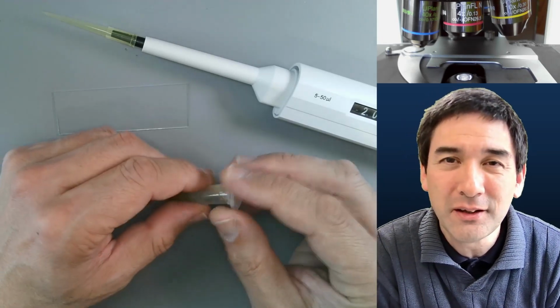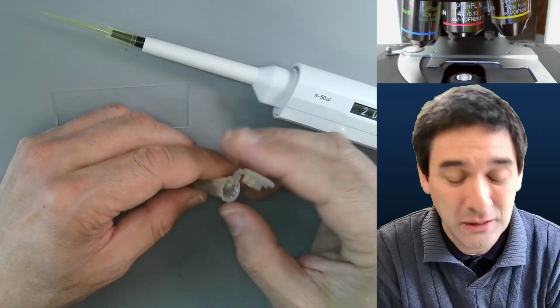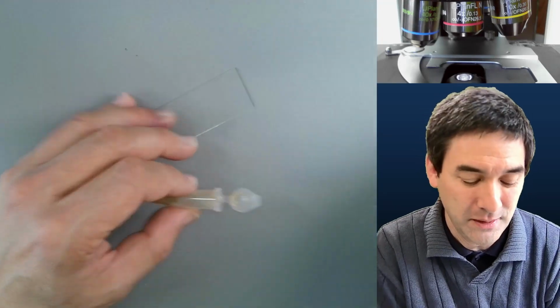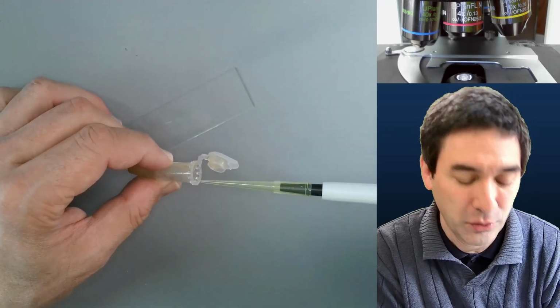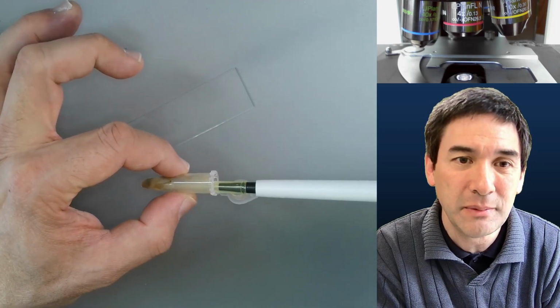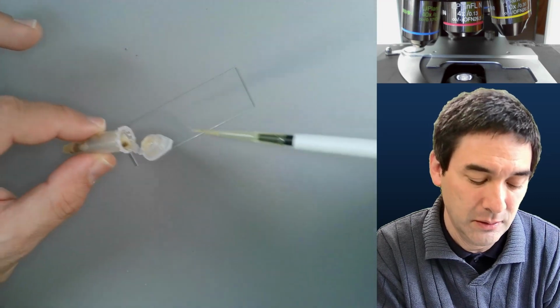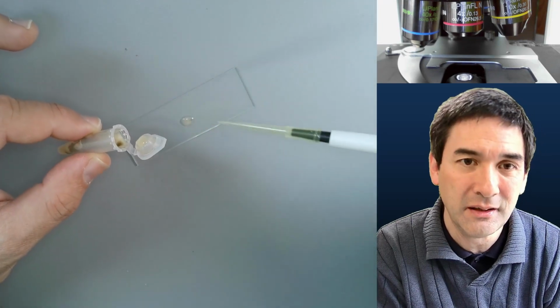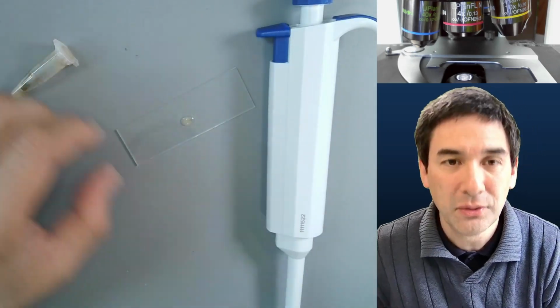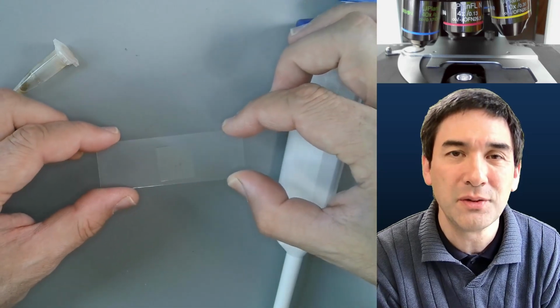I do not think that they're still viable. I do not think that they still live, but we're just gonna have a look. It also kind of changed the color a little bit. Yeah, so let's go ahead. Of course, I would like to throw it away later on. And again, let's resuspend everything a little bit. Okay, let's take a small sample on a microscope slide, and then the cover glass goes on top. And then I would like to see if there's still something interesting on here.